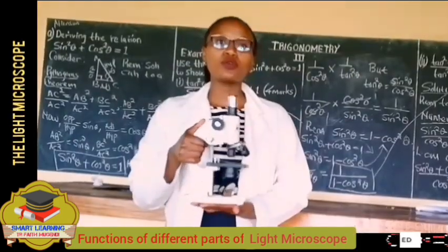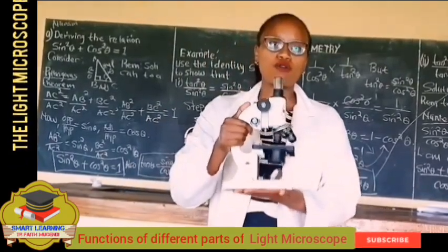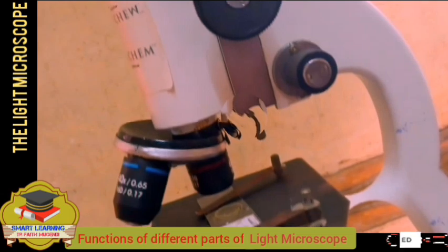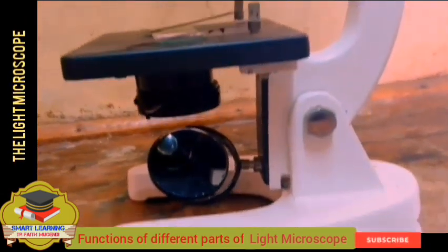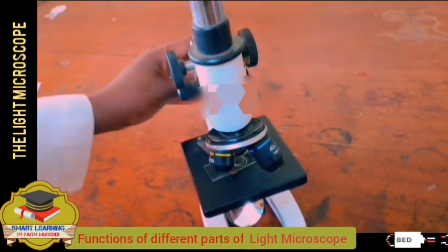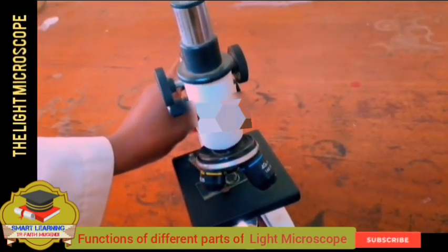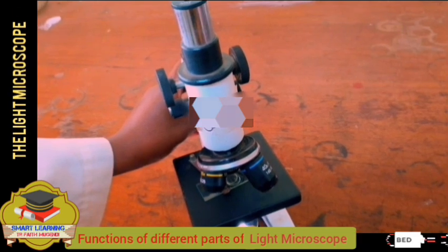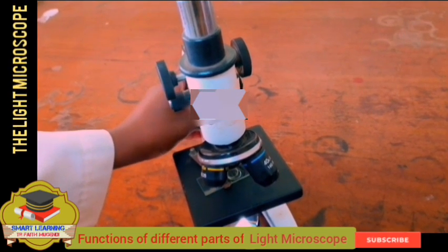In this tutorial, we are going to look at parts of the light microscope. This is what we are calling a light microscope. It is called a light microscope because it uses light to illuminate the specimen.